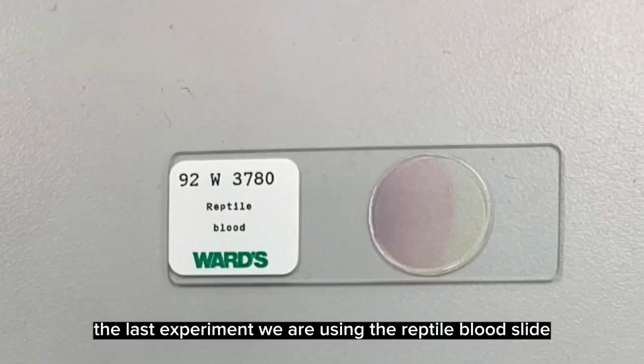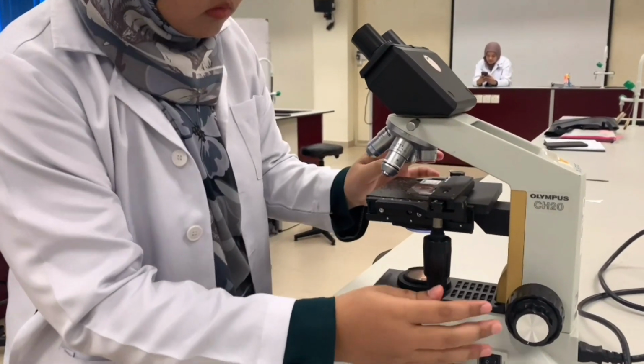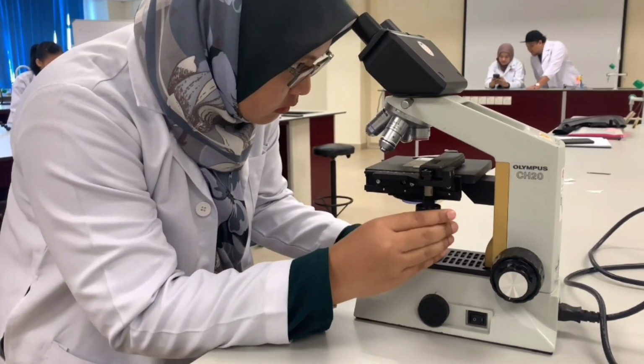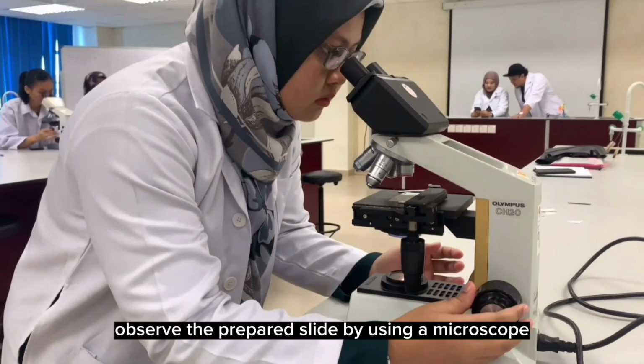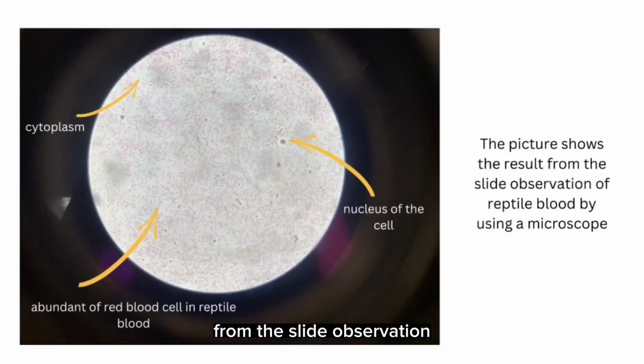The last experiment, we are using the reptile blood slide. Observe the prepared slide by using a microscope, and the picture shows the result from the slide observation of reptile blood by using a microscope.